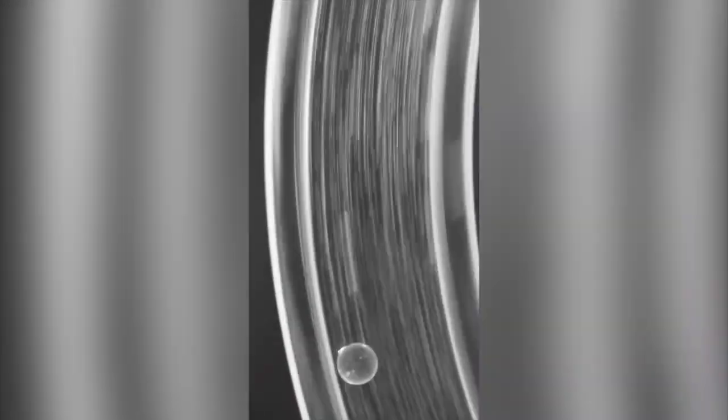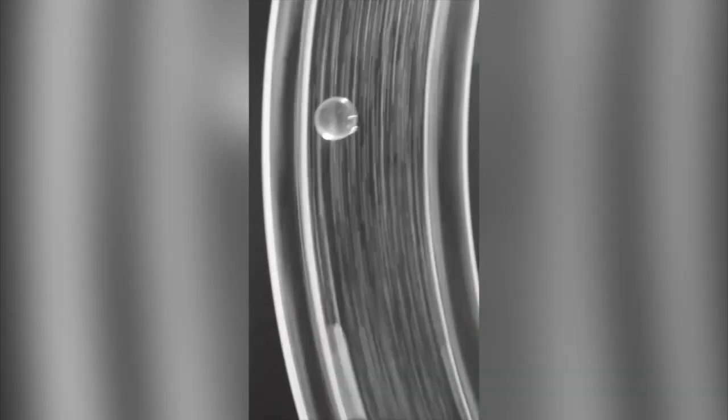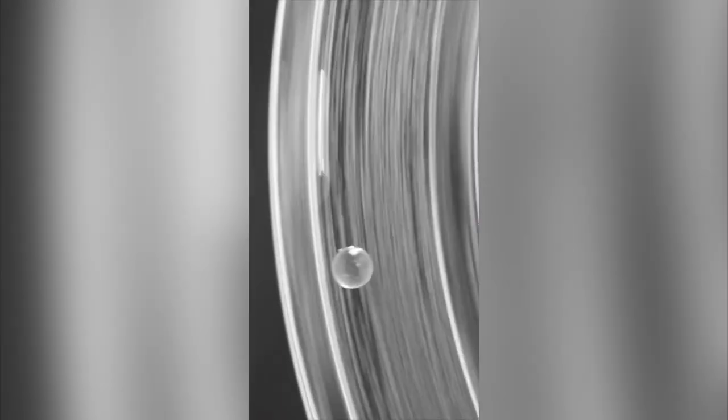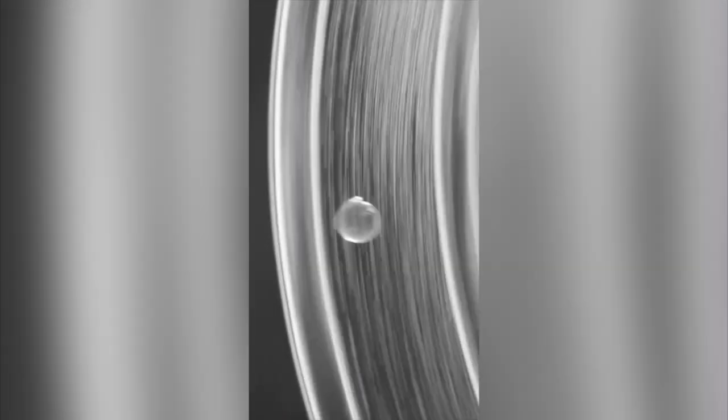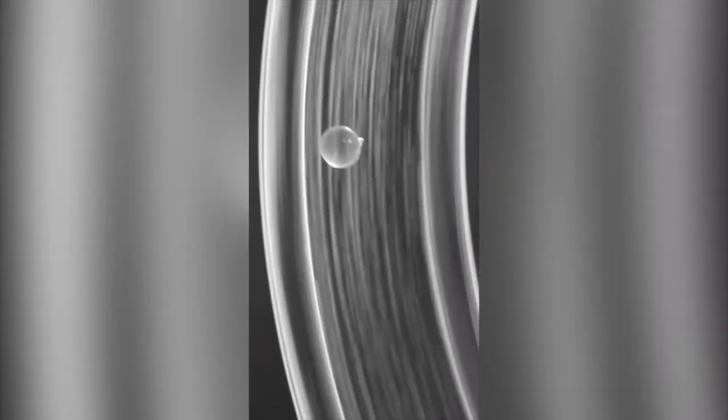We took a flexible tube, put it on a circular frame like a bicycle tire, and we literally were rotating it with our hands to see if the idea works.